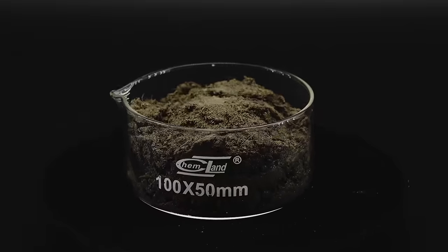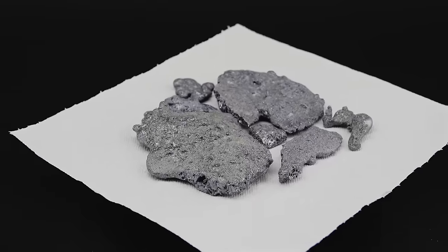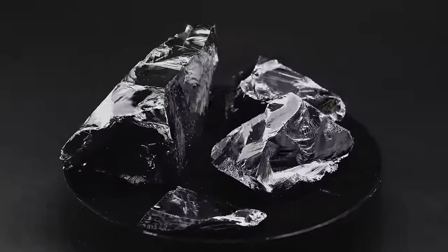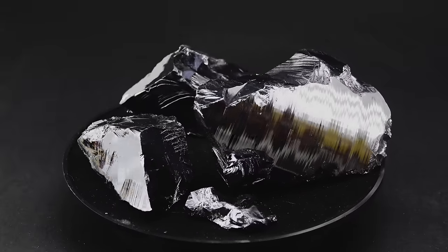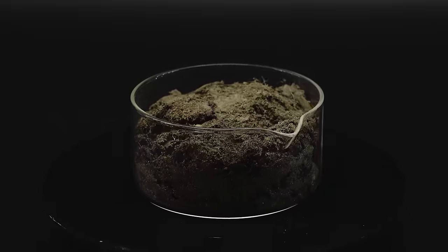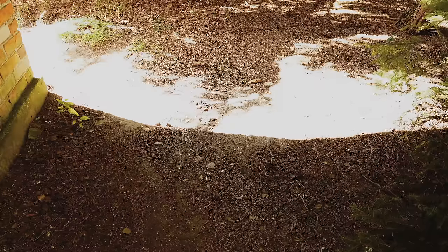As with nearly every one of my videos, I could of course skip the whole time-consuming and challenging part and just buy the end product, which in this case is silicon. I actually own a kilo of it which is so pure I could use it to make a computer, but I won't involve it in this project because I think that chemistry is more about the journey than the final result, and these conversions are always a lot of fun and make lots of people learn something new.